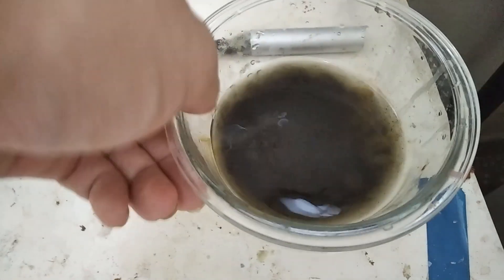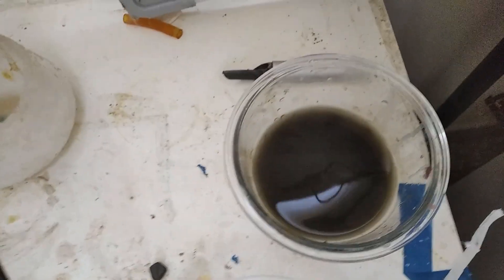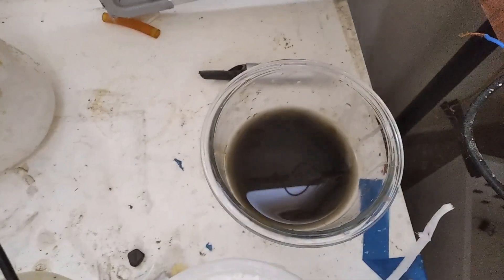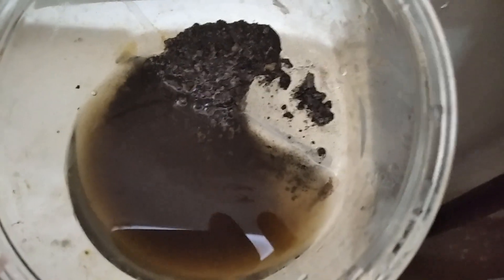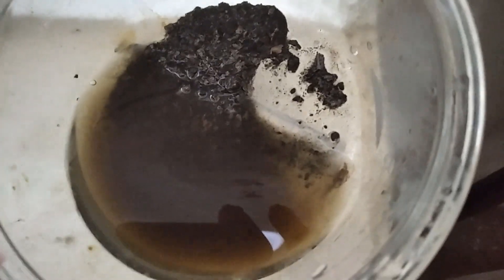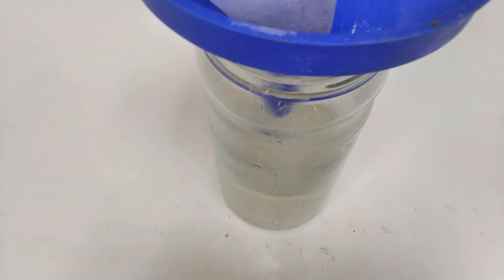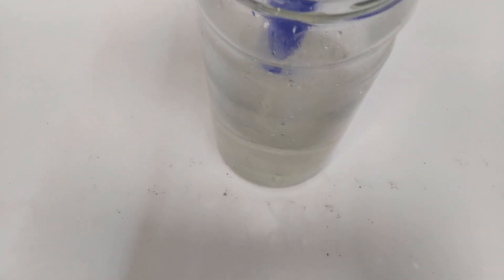To get rid of any oxide that has permeated the product or any other byproducts, a little acid is needed to dissolve them. After dropping in some HCl, the powder is a lot shinier — you can see the shiny iron again. This won't last, so draining and drying the product now. While filtering, make sure to filter through a lot of excess water, because if you don't and the iron becomes pyrophoric, you'll end up making a giant whoosh bottle and a lot of stuff will burn.